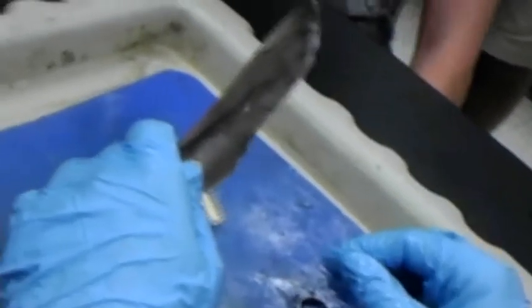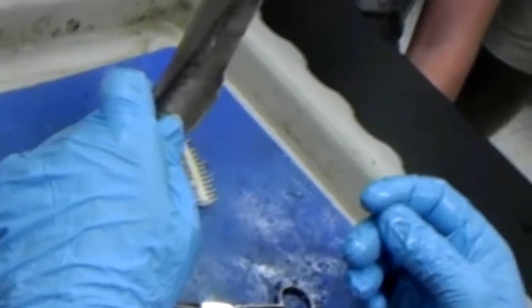And that's then when we have the swim bladder come in the other fish, that's where we have a selection away almost from the asymmetry of the caudal fin. What did I say, almost selected away from? Because the urostyle still shows evidence of that asymmetry.